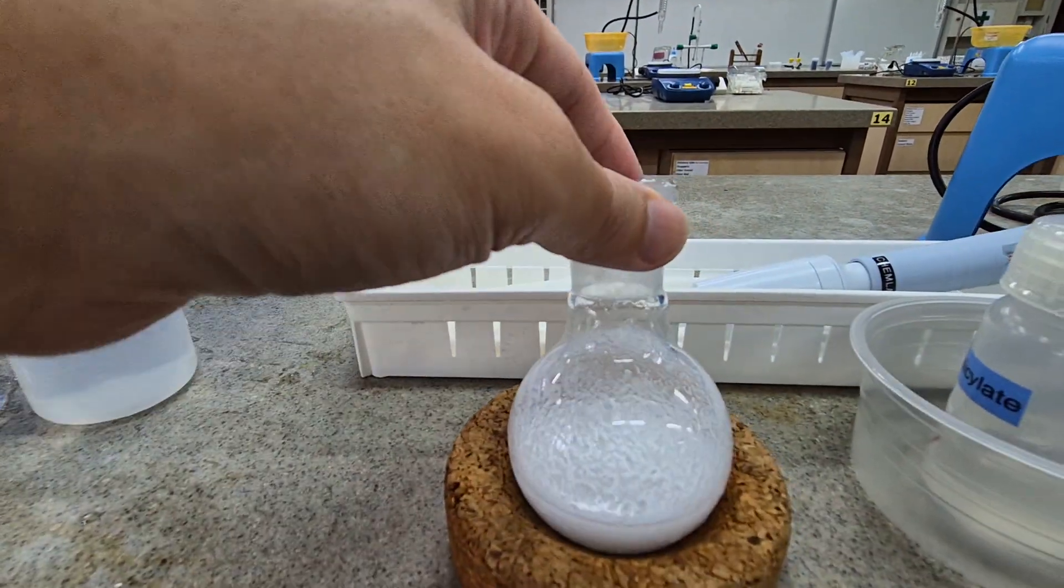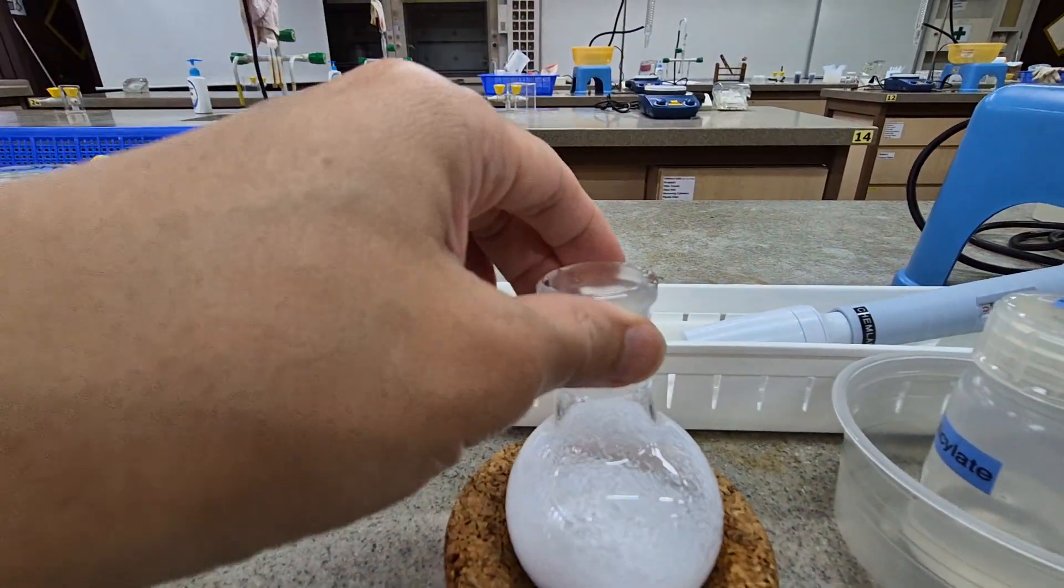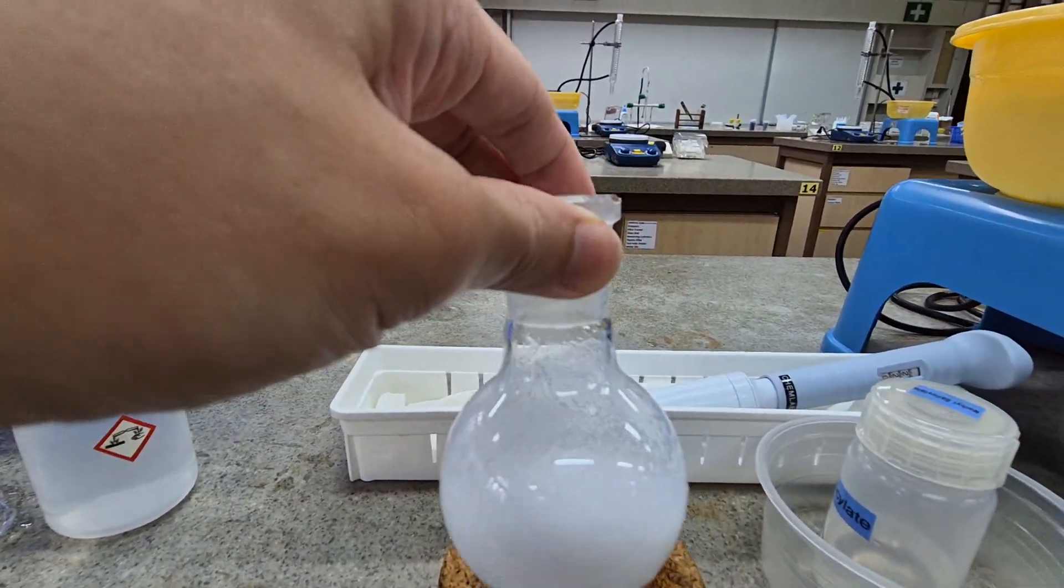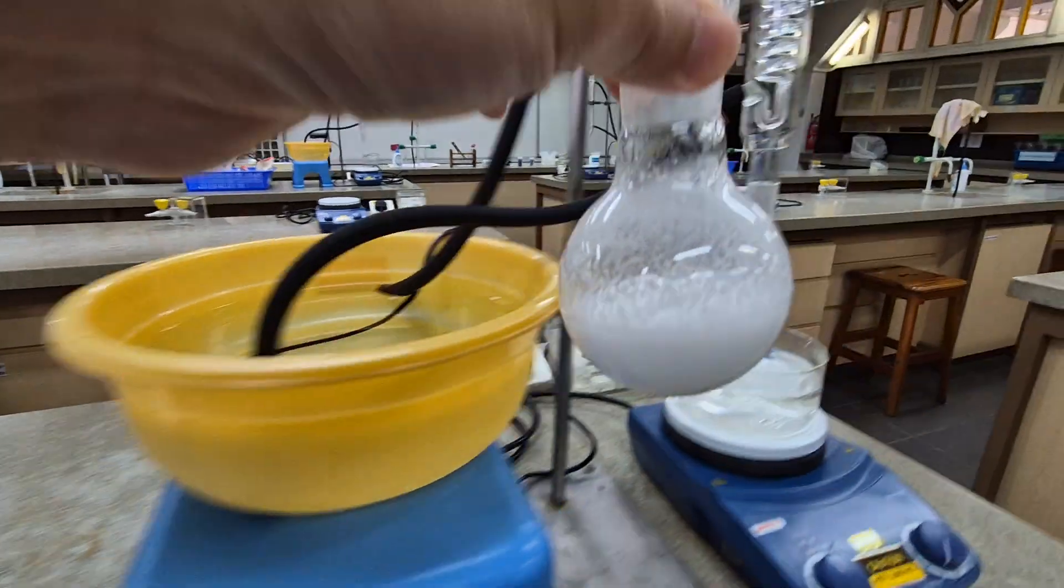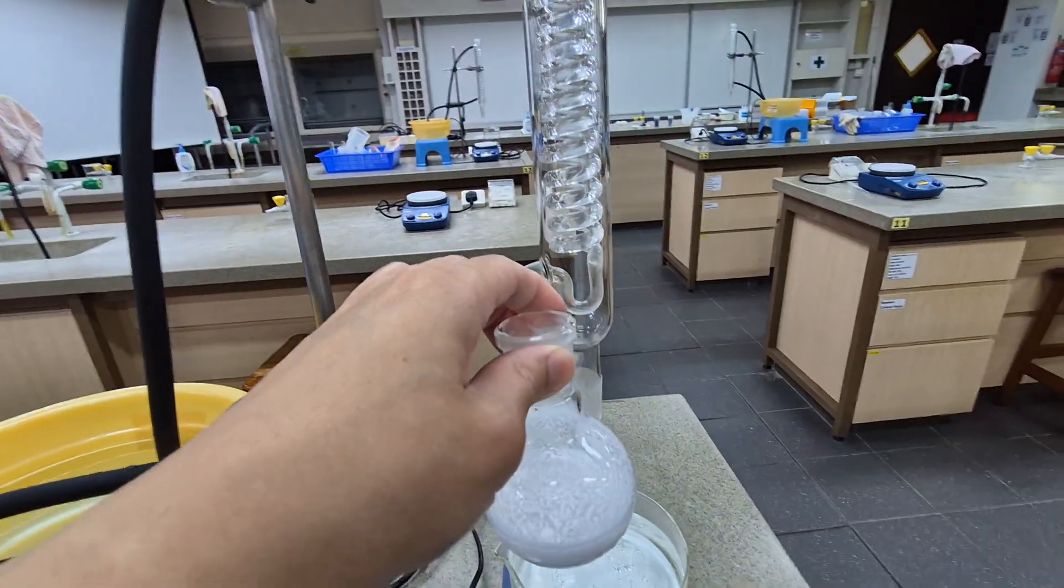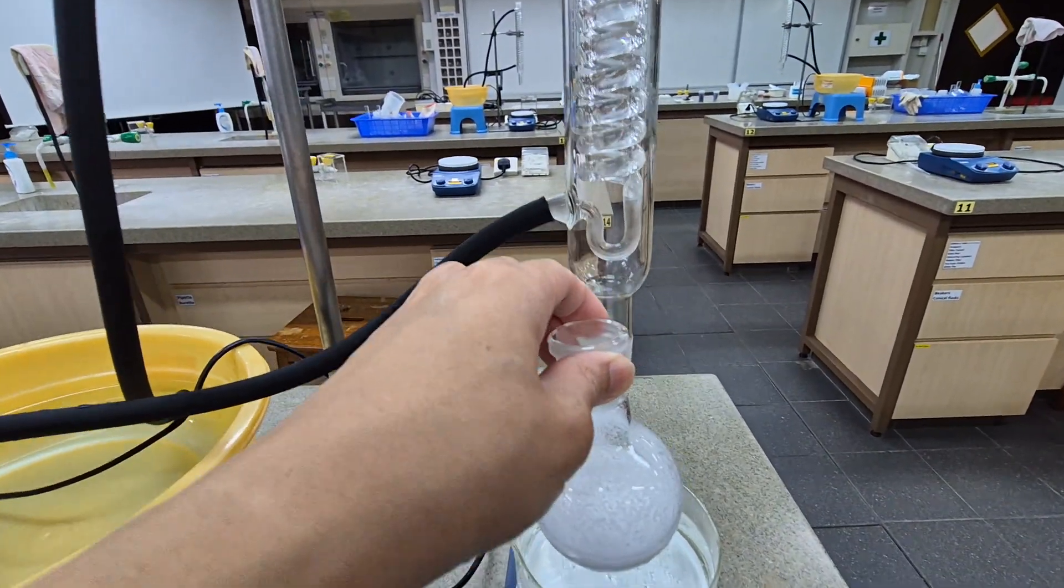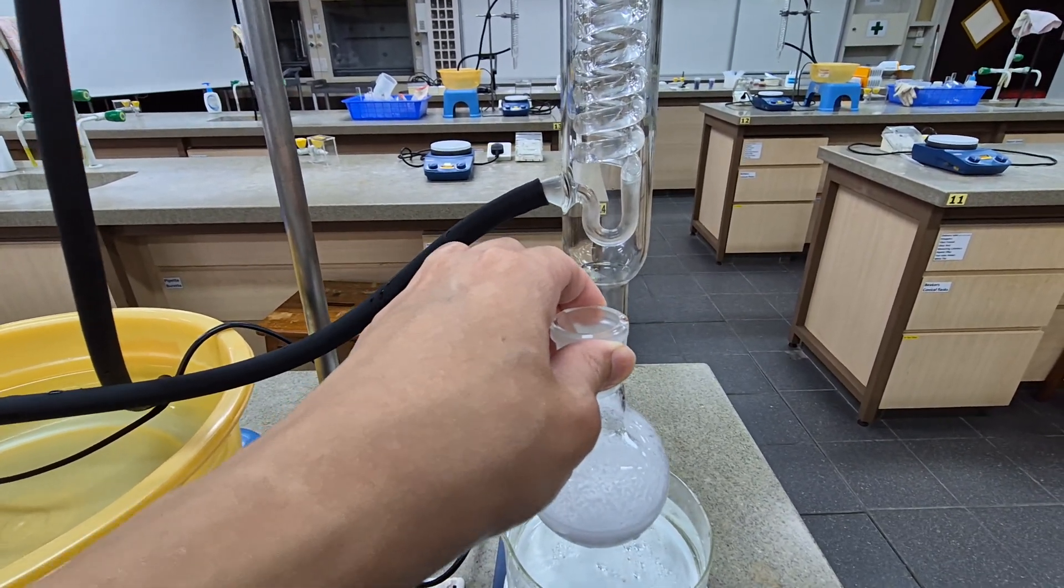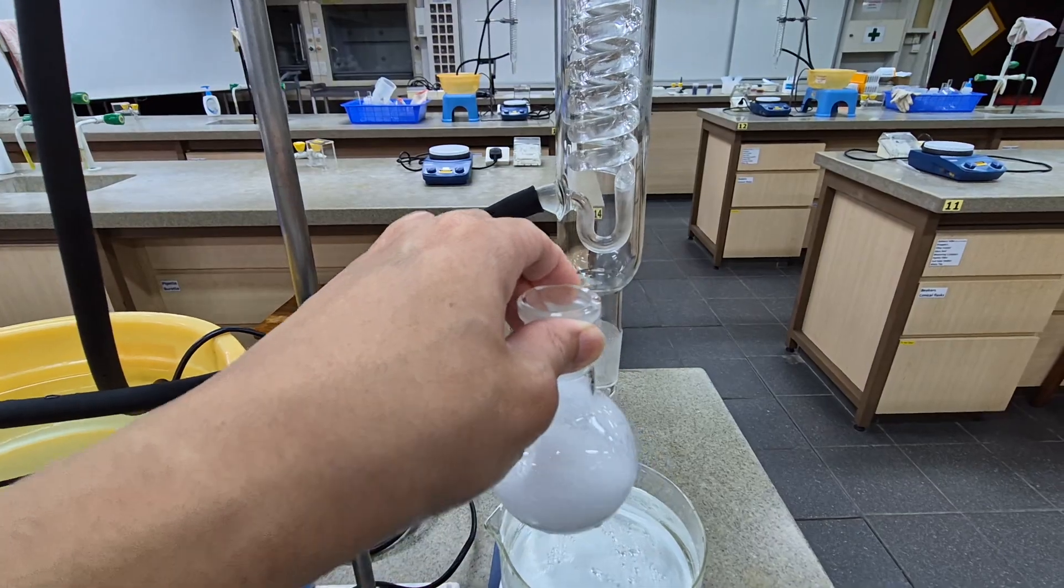What's going to happen now? I'm going to clip it over here. Because I'm holding the cap with my phone, I can't do it simultaneously. So I'm going to clamp it, and then I'm going to show you what's going to happen after I set up the reflux.